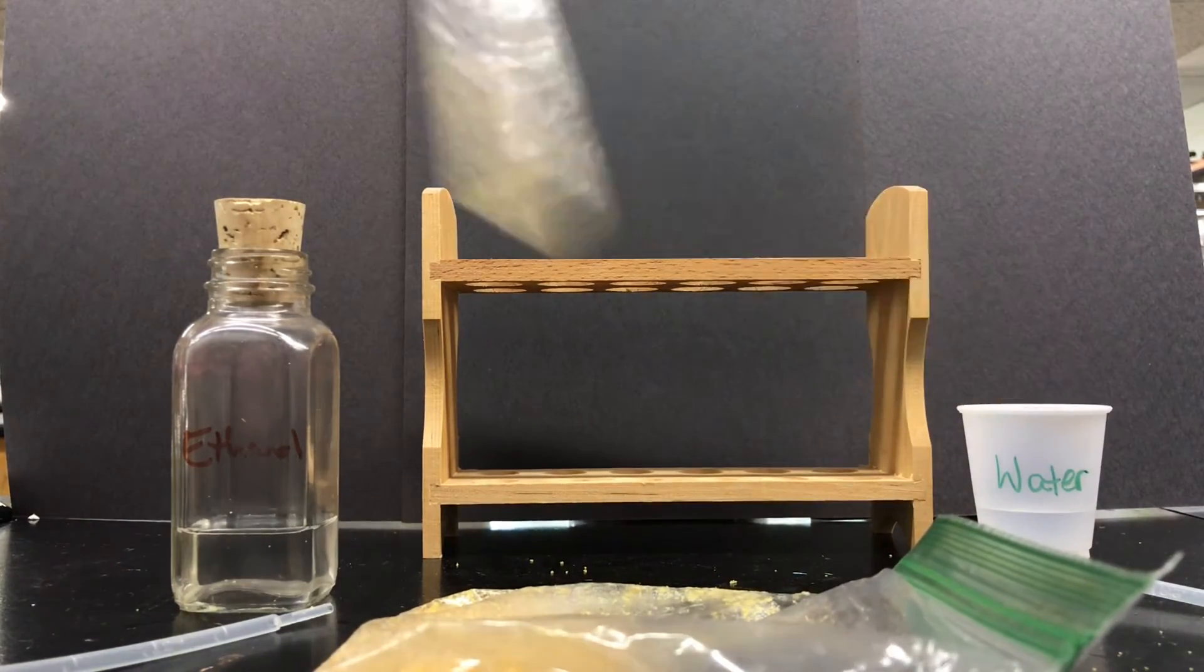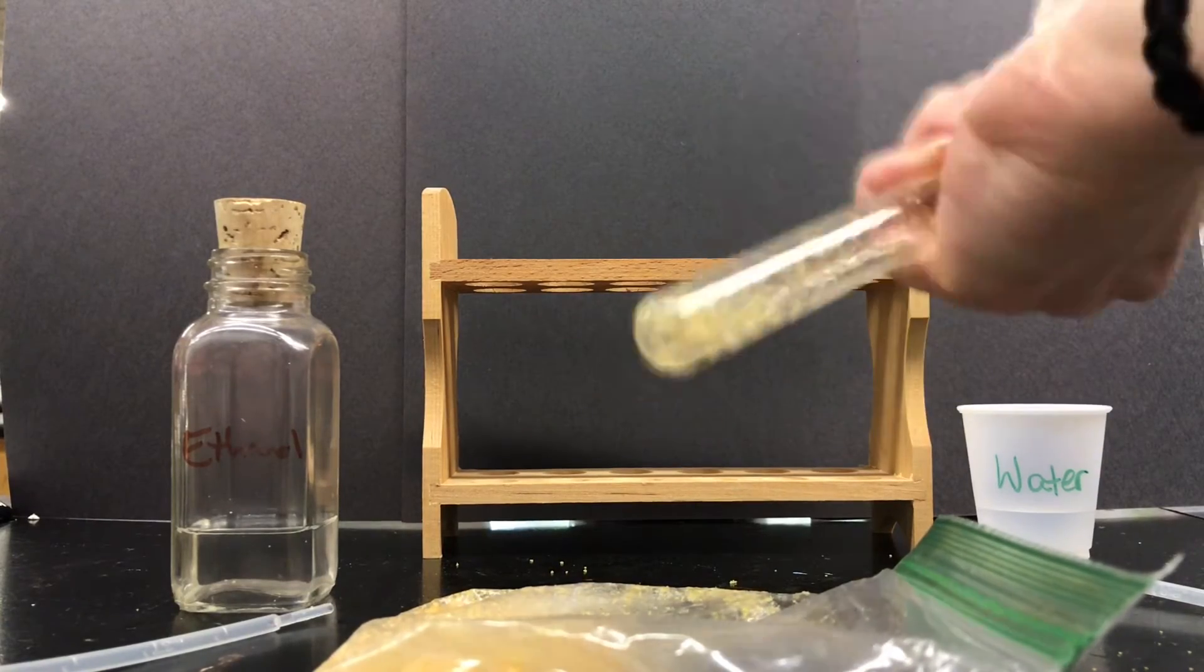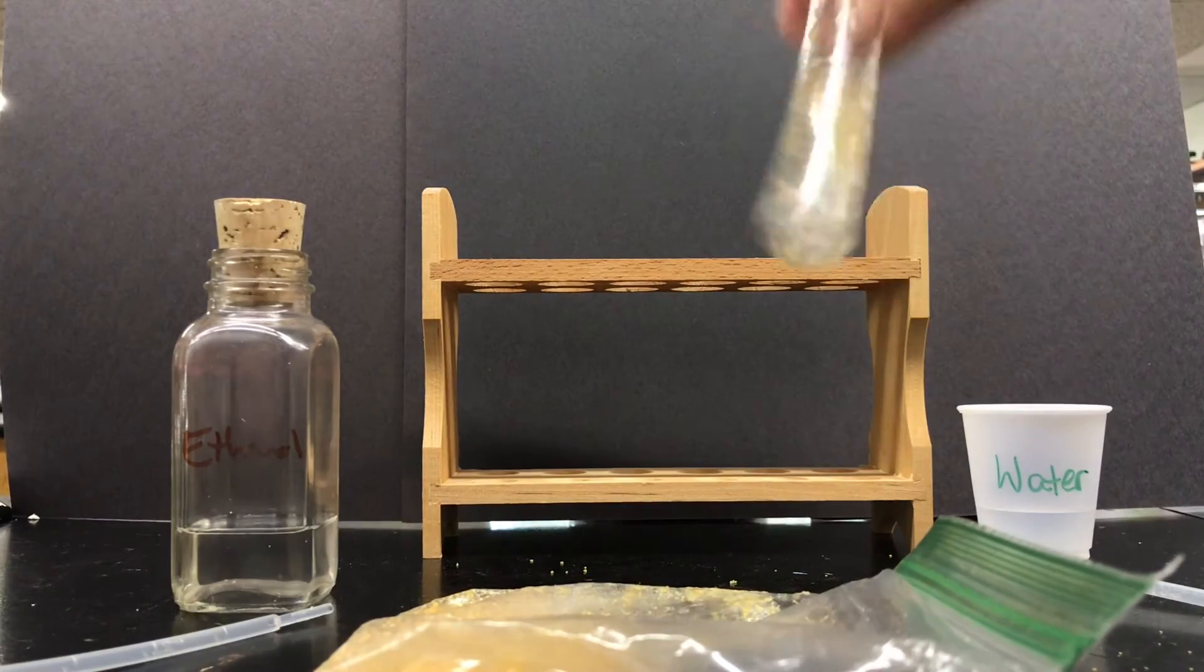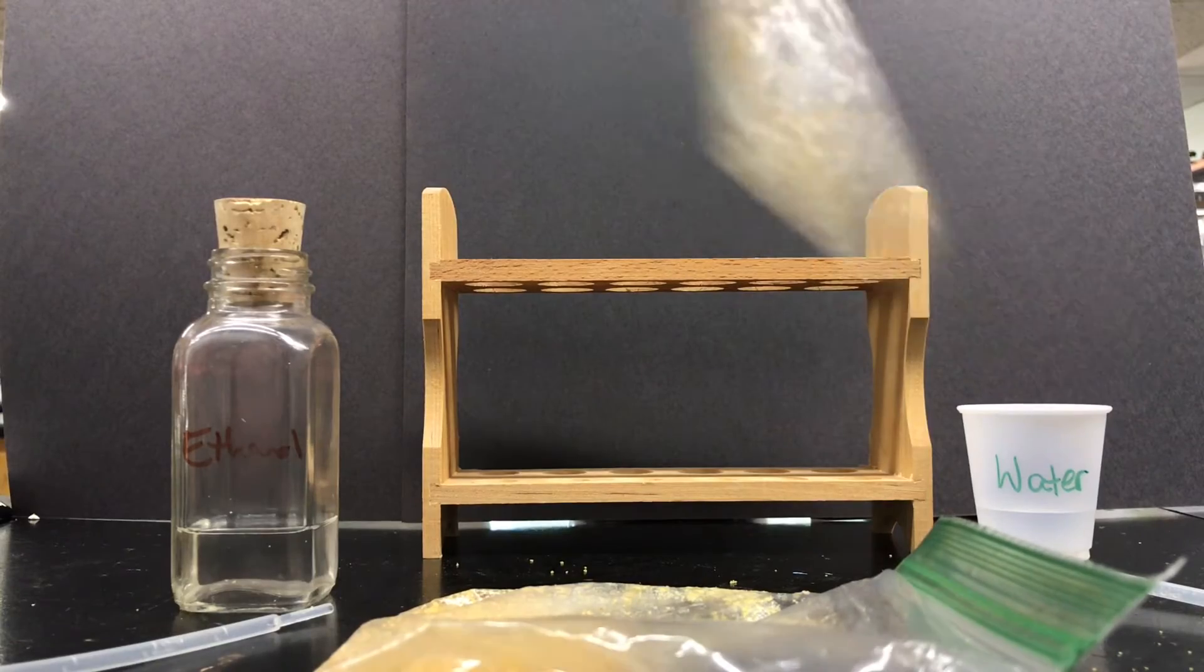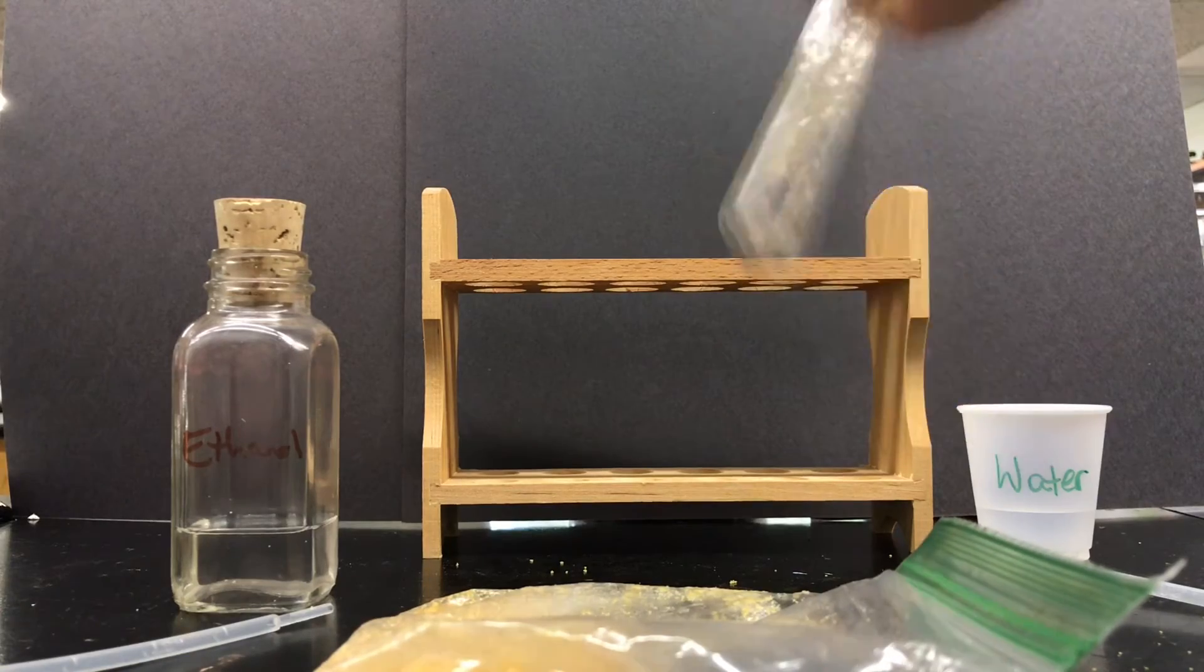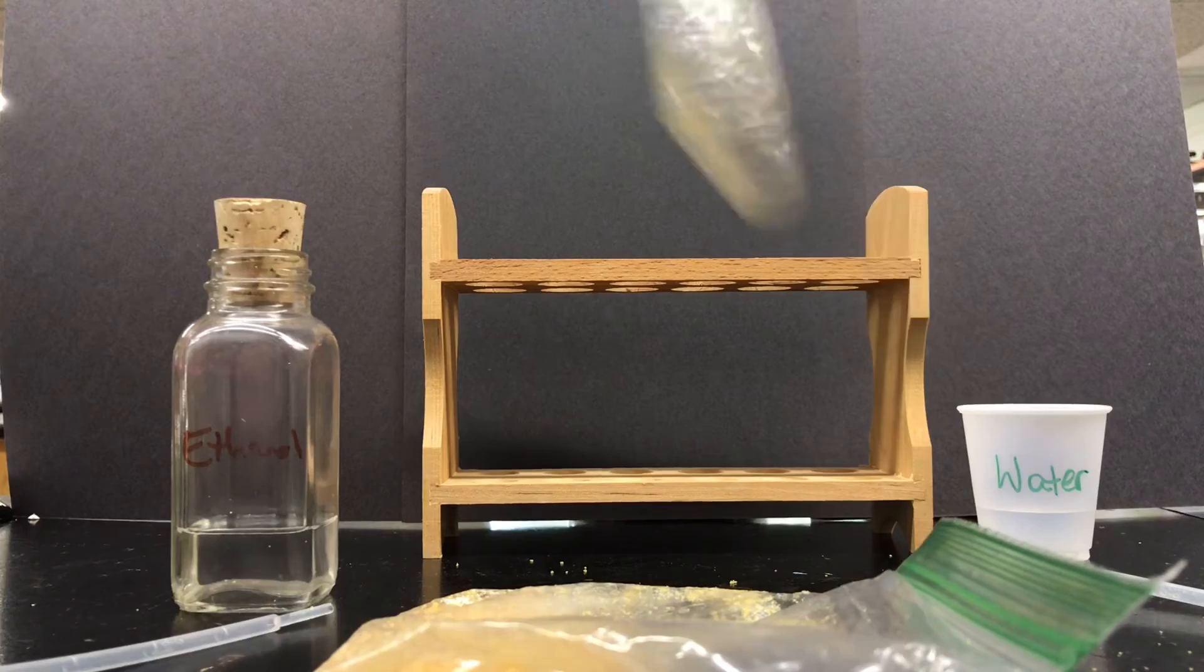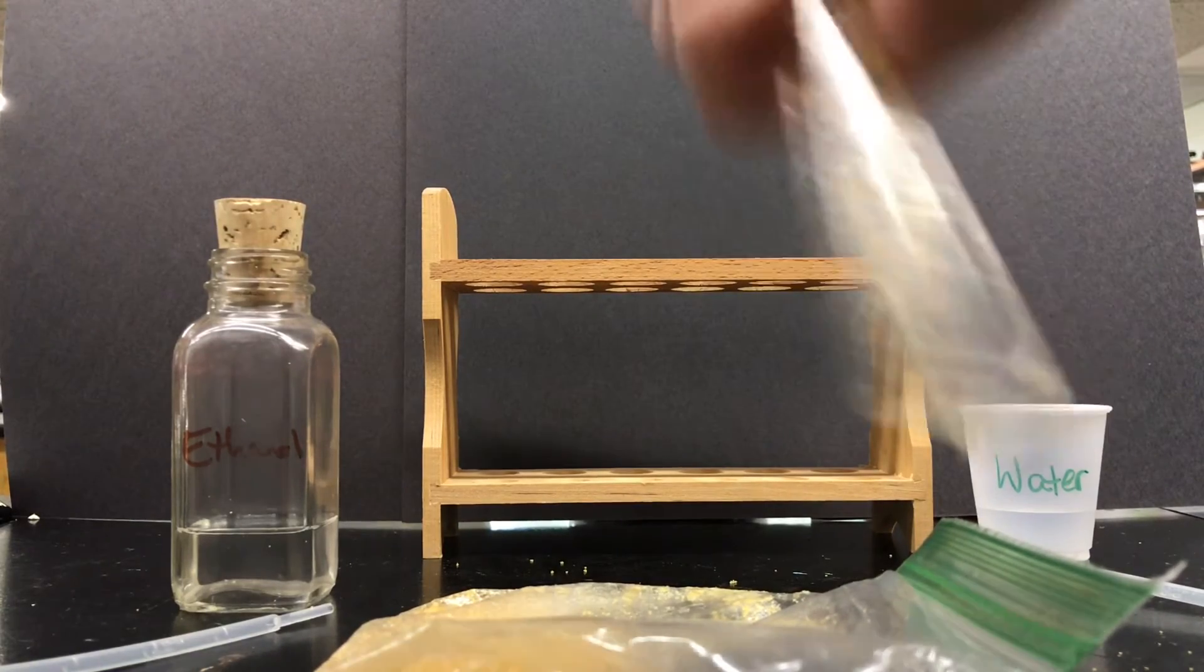our sample in the ethanol. You're going to shake it up really really well. Now the reason that we are using ethanol is because lipids dissolve in ethanol but lipids do not dissolve in water. Okay when you do this I want you to shake it for another minute or two.